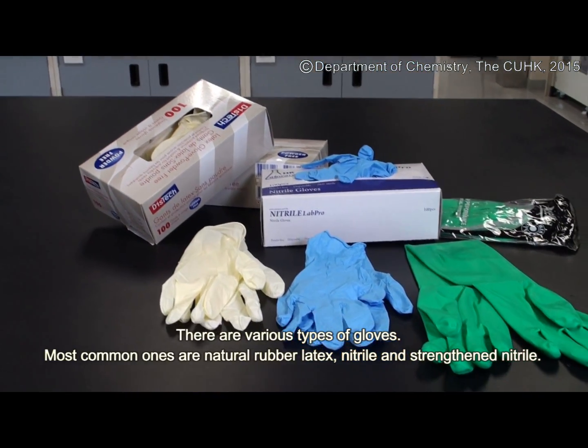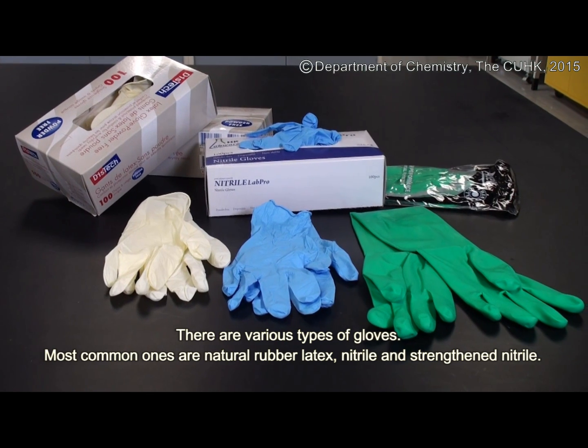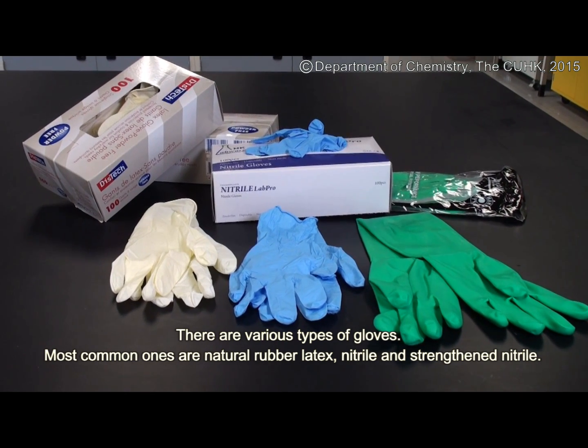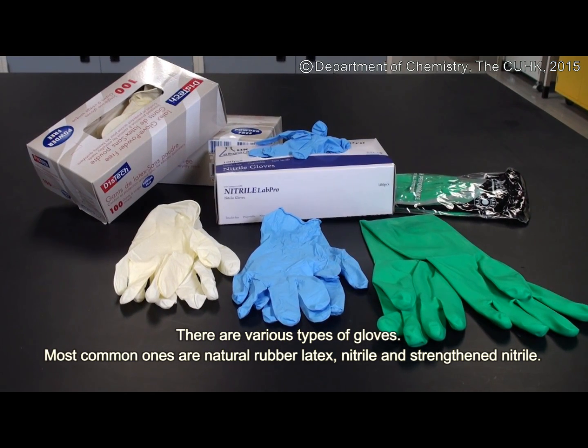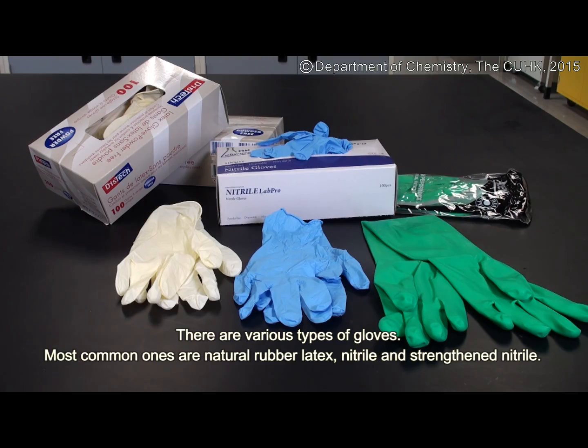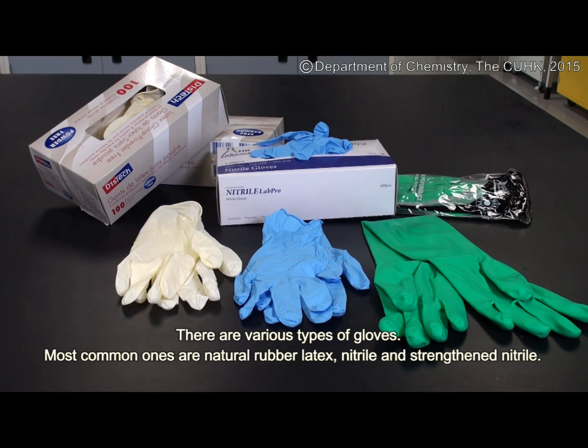There are various types of gloves. The most common ones are natural rubber latex, nitrile, and strengthened nitrile.